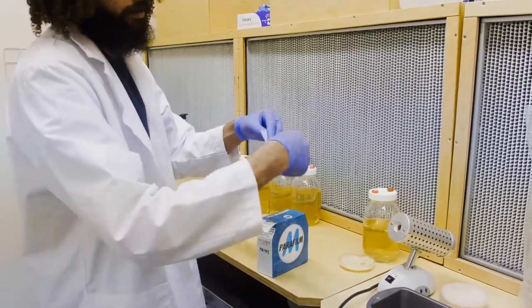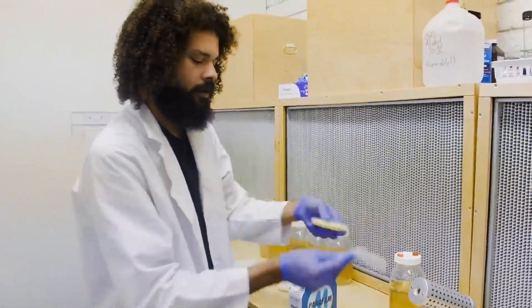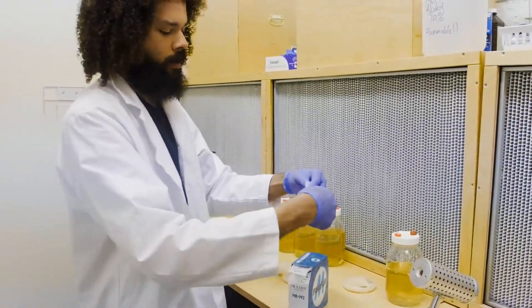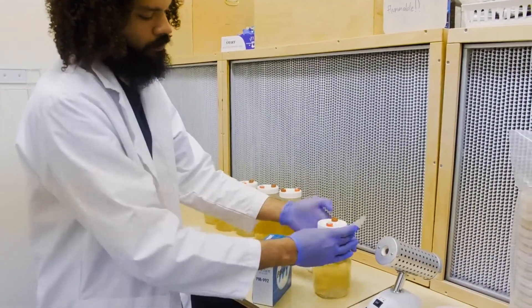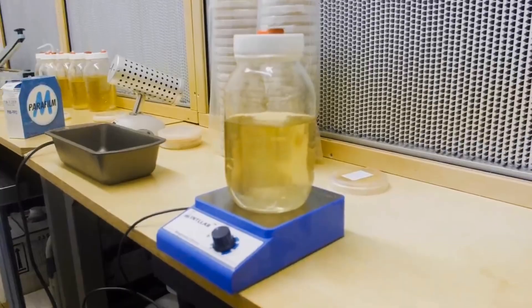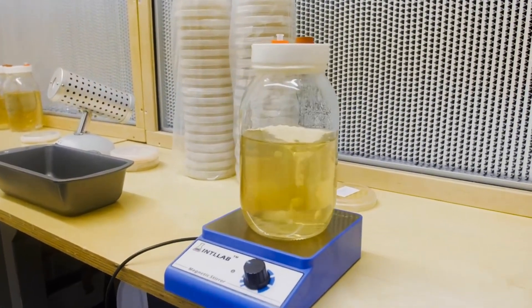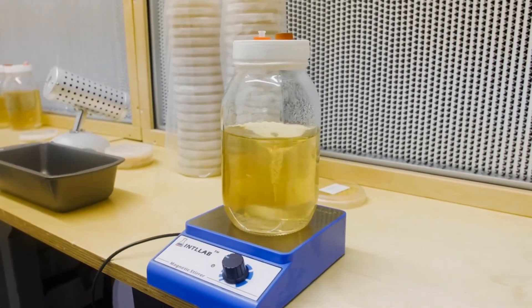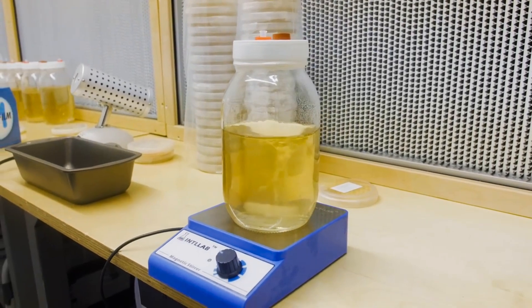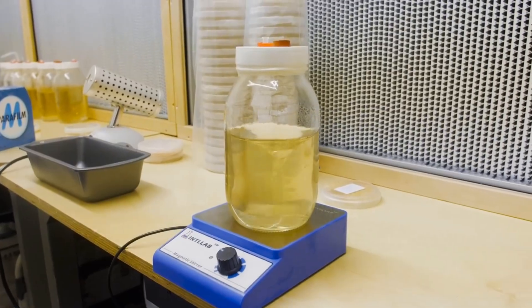Just throw that on the ground so we're not reaching down while doing lab work. I'll also wrap up the rim of our jar lid - that's because I don't have any gaskets right now. Start agitating the mycelium. Hopefully little fragments of mycelium fall off and get spread throughout the water and form a chain of growth that we'll see over the next few days.